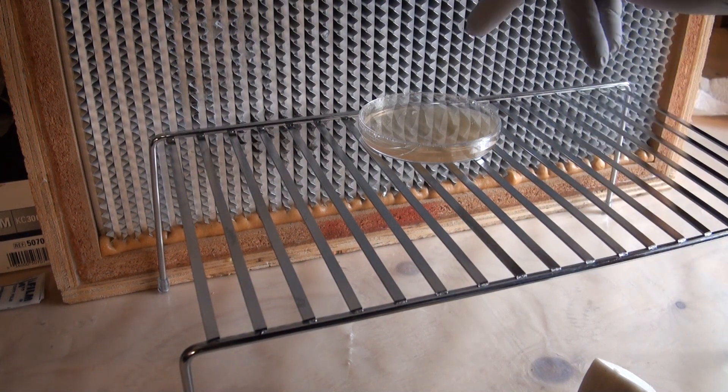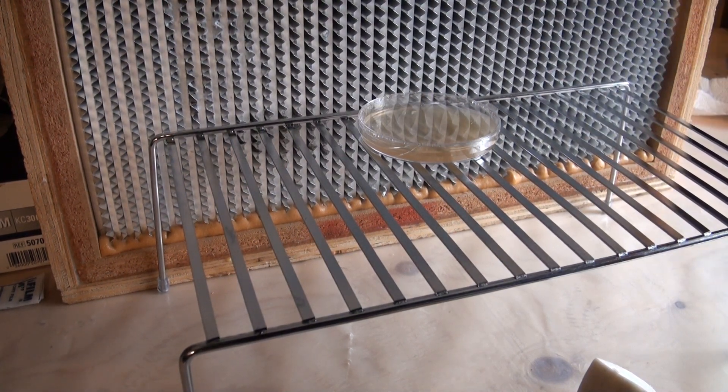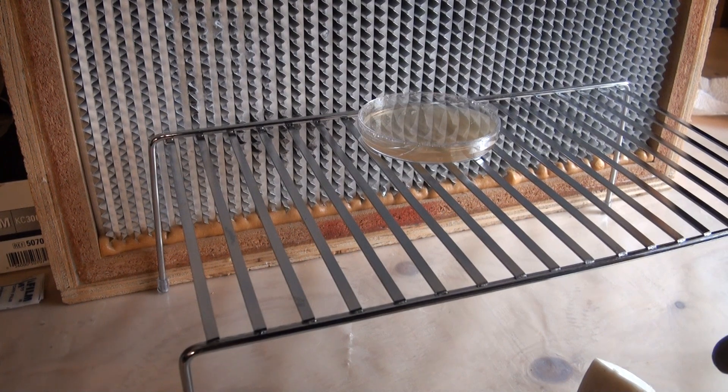Now I'm going to repeat that process, putting three separate pieces of tissue on each plate. You can probably do about two or three different plates.